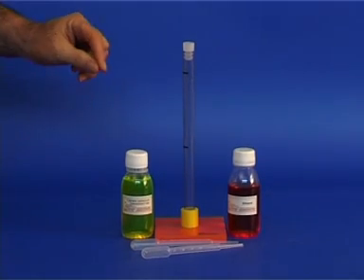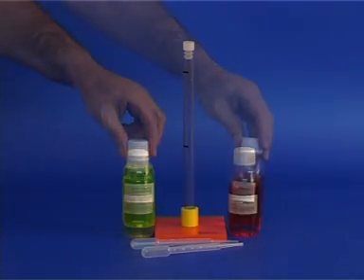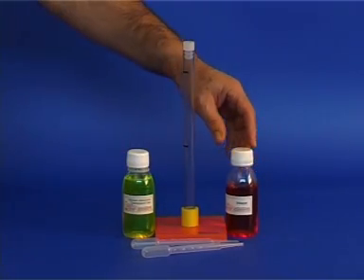We have two bottles. One contains green colored water and the other red colored ethanol.